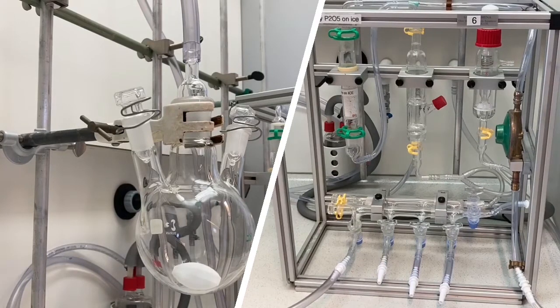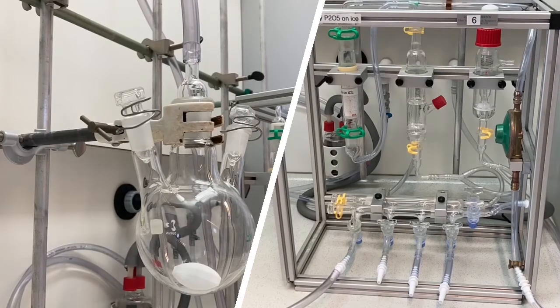Now we have our reaction flask under nitrogen — we have replaced all of the oxygen inside. You can now start a reaction under nitrogen. This would also work with argon or other gases not normally present in air. When adding compounds to your flask, always do it with the nitrogen tap open so that no oxygen can get in.